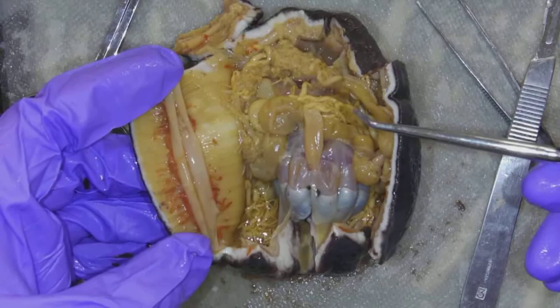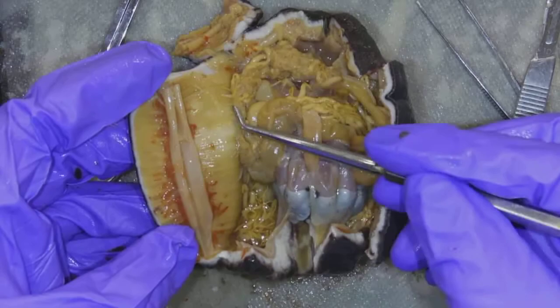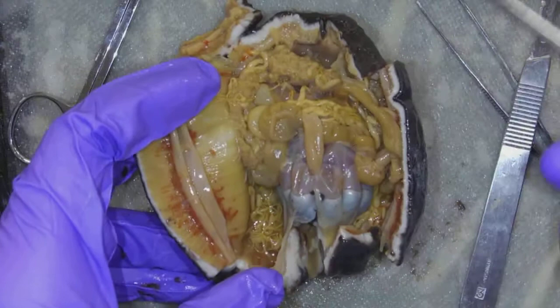First off, I had to cut these muscles that go up and down the body — those cause the animal to contract. These are the longitudinal muscles. We can also see circular muscles going in this direction, but I cut those longitudinal muscles.